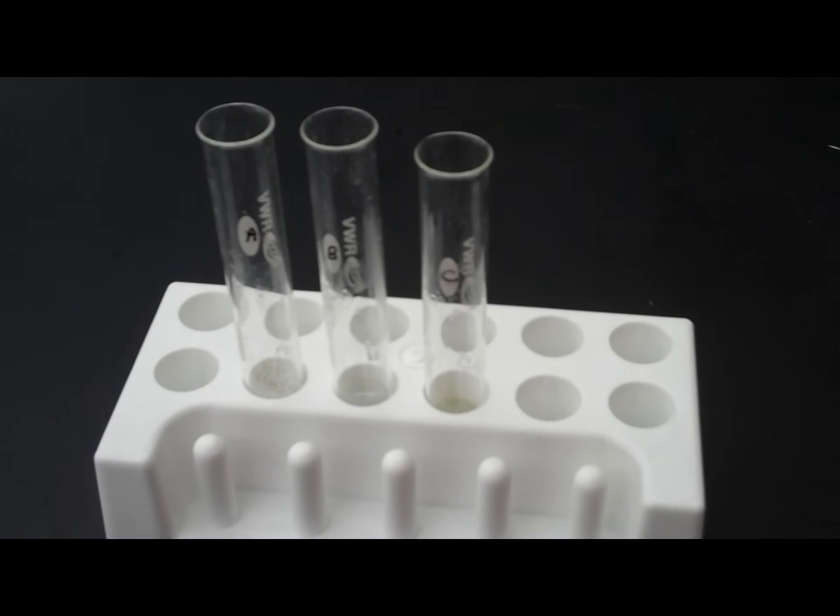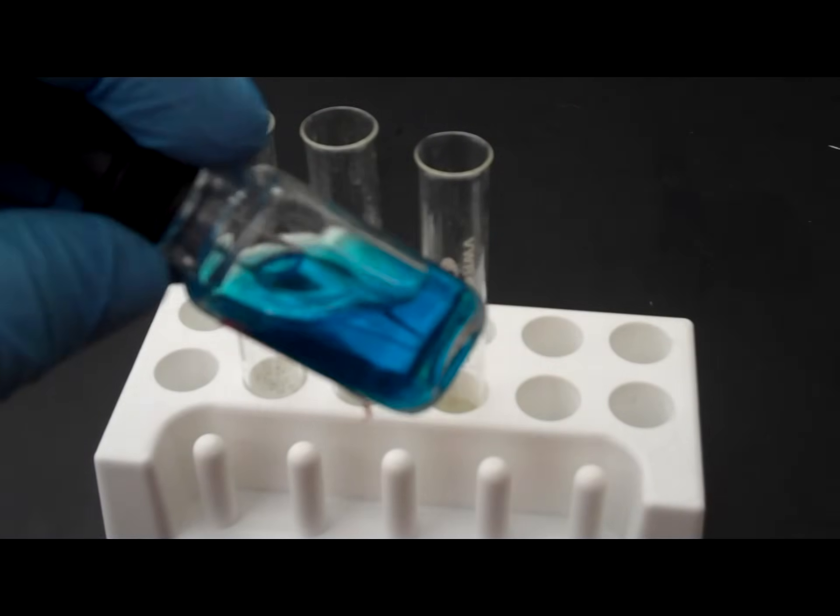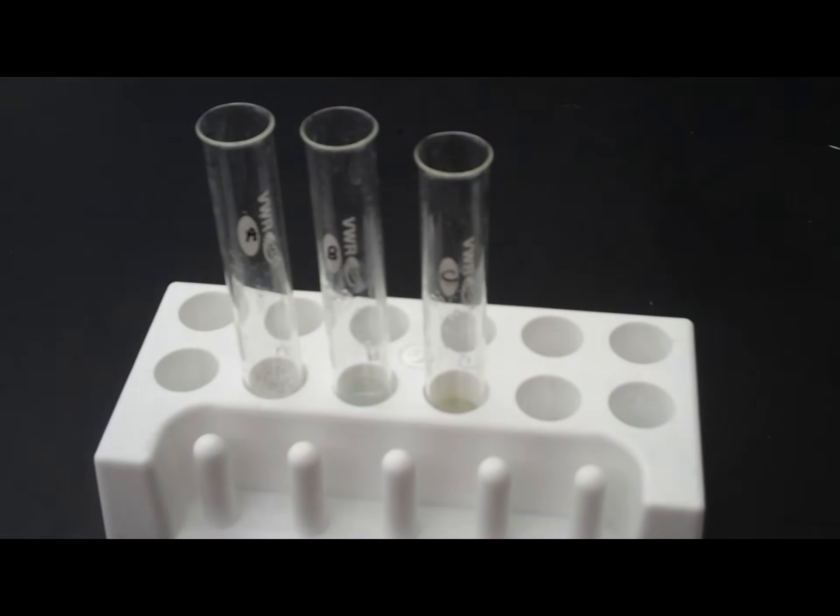Benedict's solution, which is this blue solution here, is a test for simple sugars. If only starch is present, then Benedict's will stay blue. If the starch solution converts into simple sugars, the starch solution will turn orange to reddish, orange to red, depending on the amount of simple sugars present. So, we're going to let these sit for a little bit.